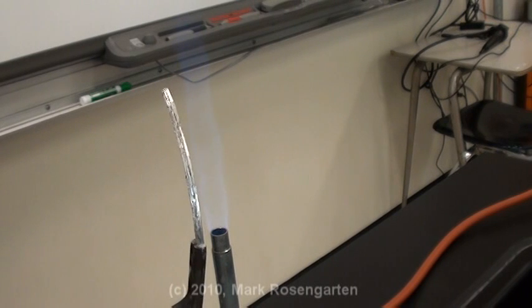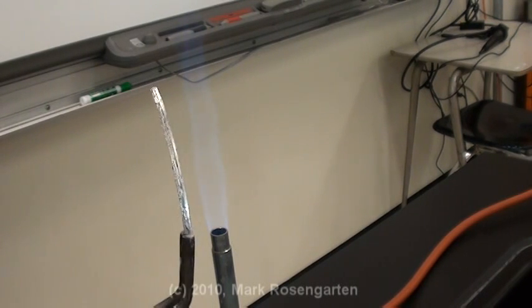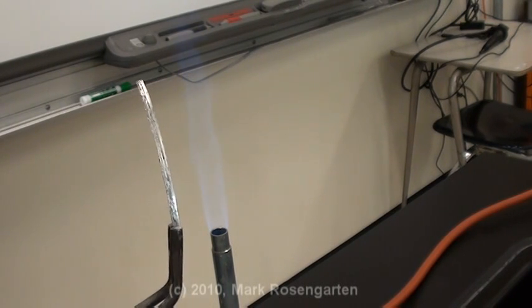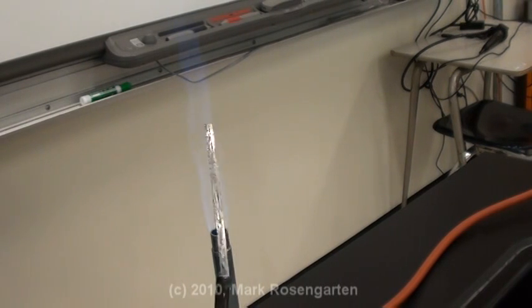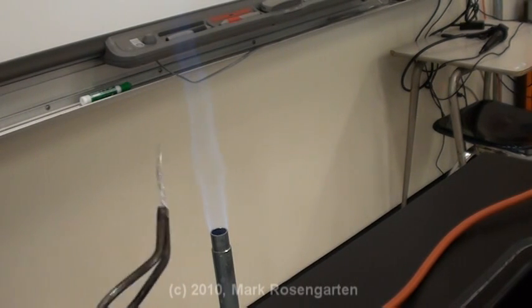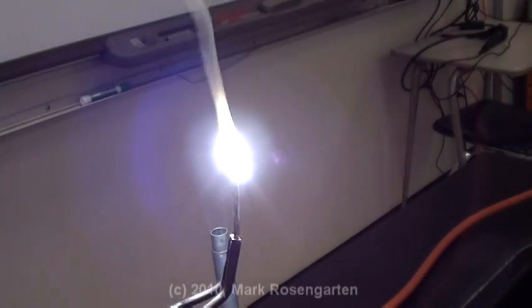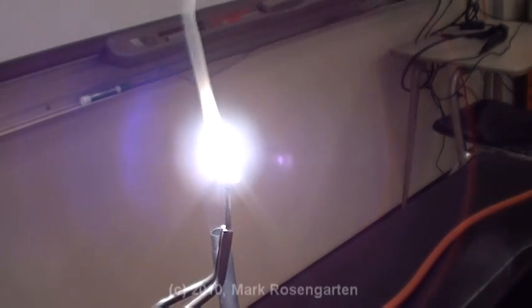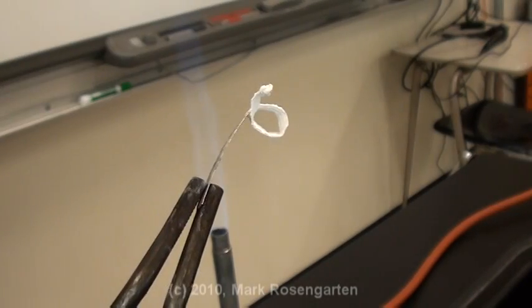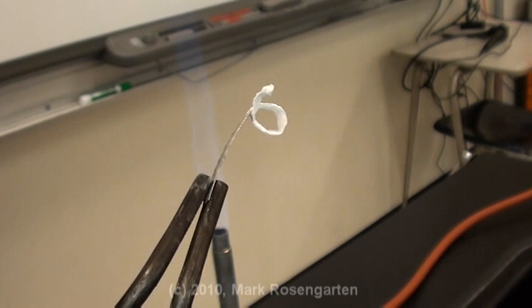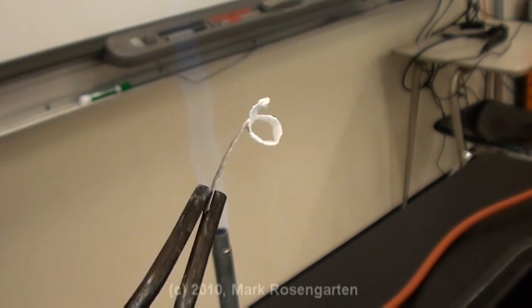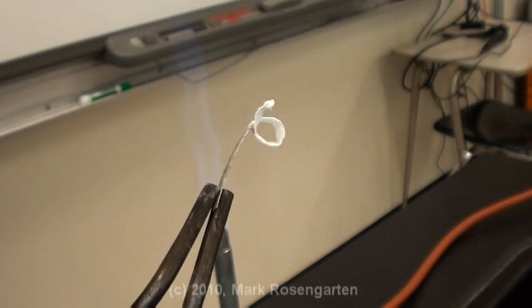Now we're going to try magnesium and oxygen. The difference here is that magnesium is a group 2 element. Group 2 elements are fairly reactive. Did copper do this? You can actually see the white smoke of magnesium oxide being given off at the top. This white stuff that remains is magnesium oxide. You'll notice that this reaction was a lot more exothermic than the one with copper.